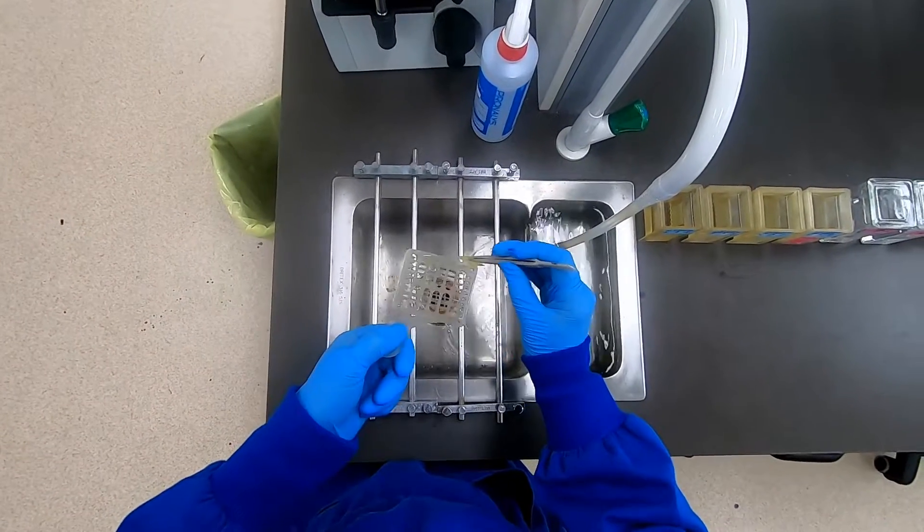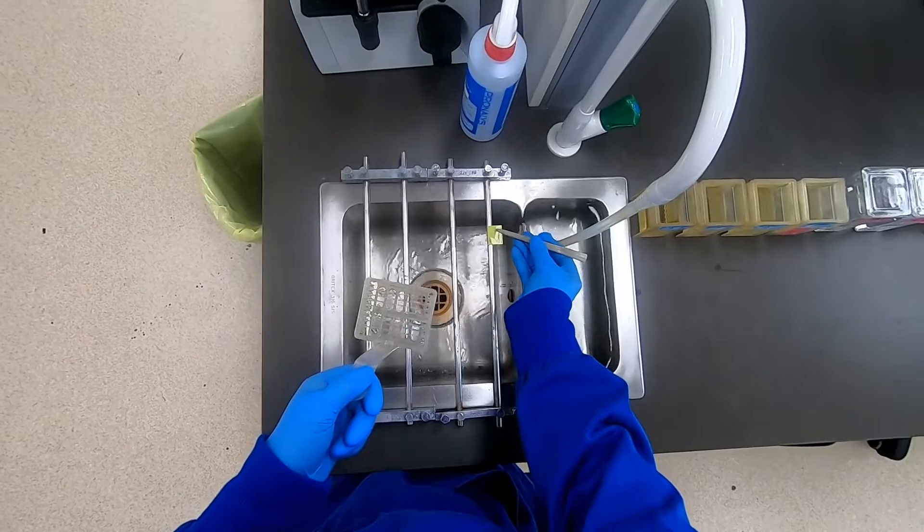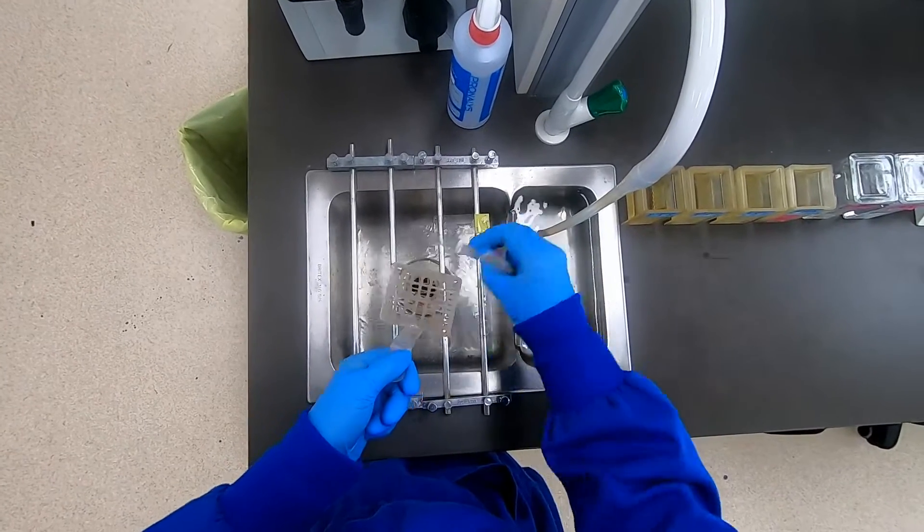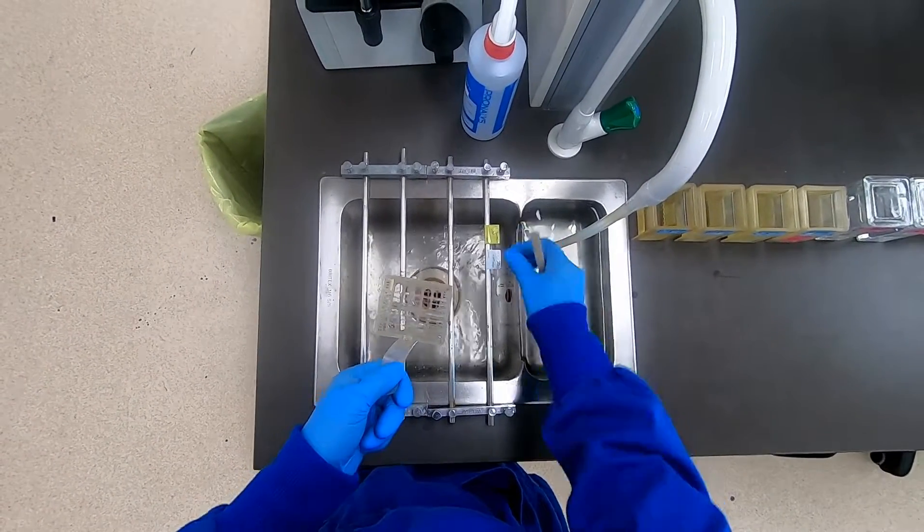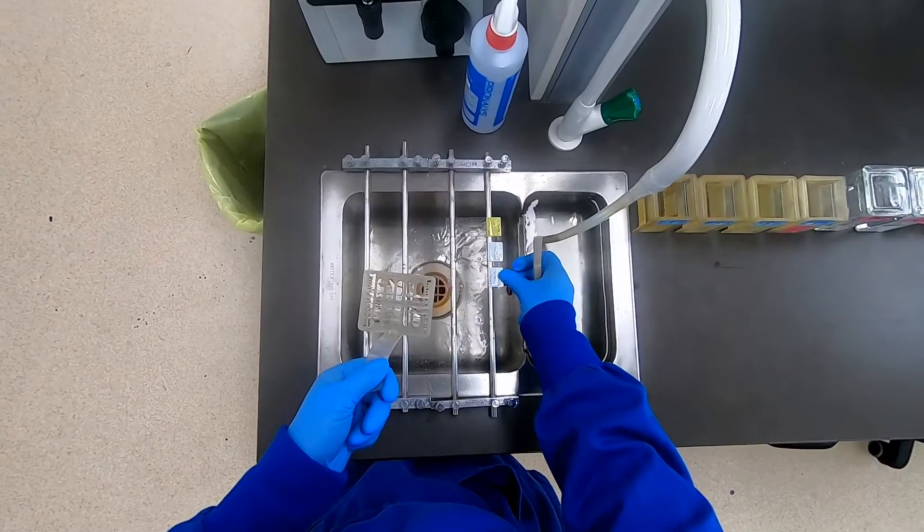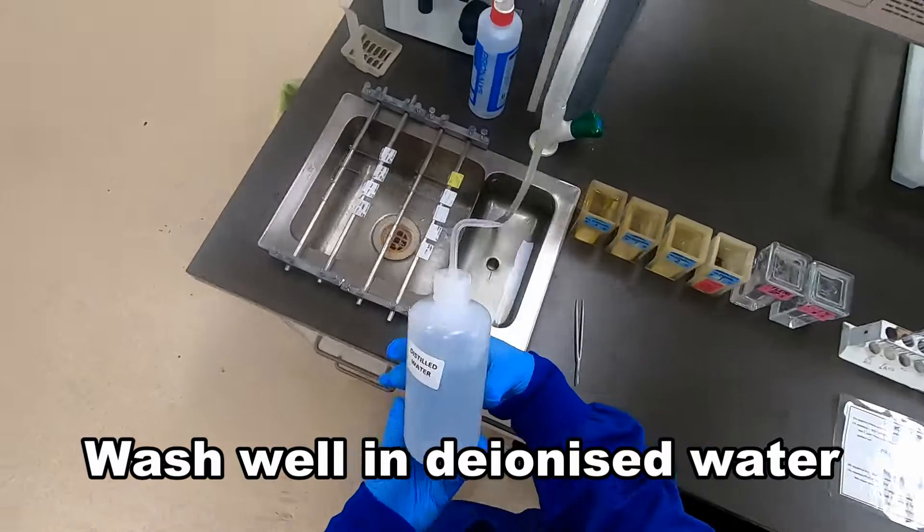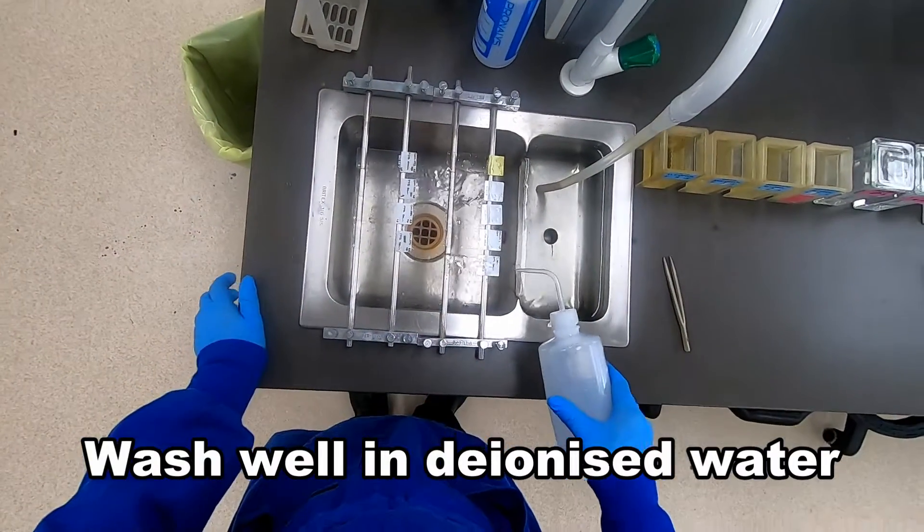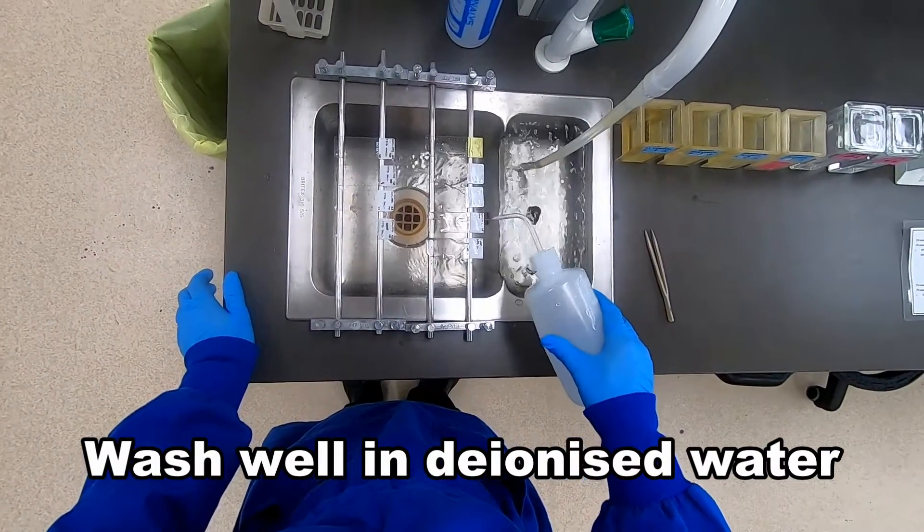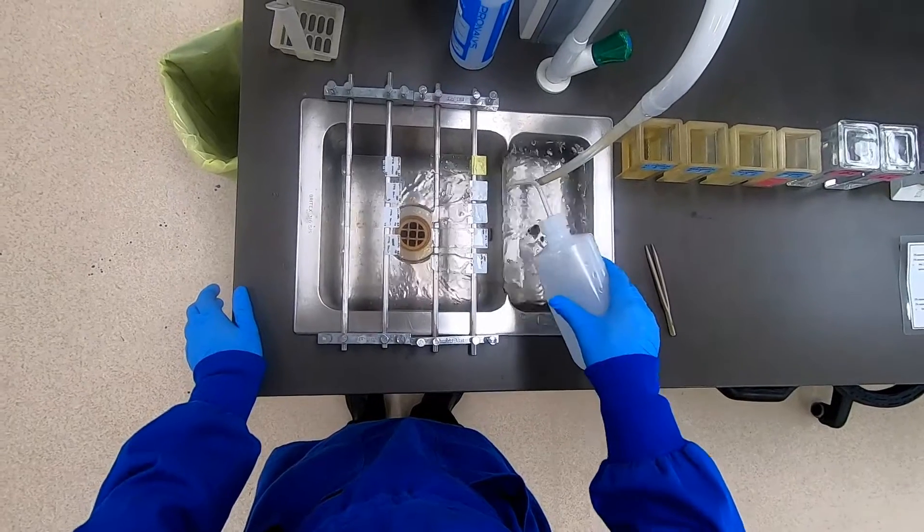To begin, we've already taken some slides down to water by deparaffinizing in xylene and taking through the graded alcohols.